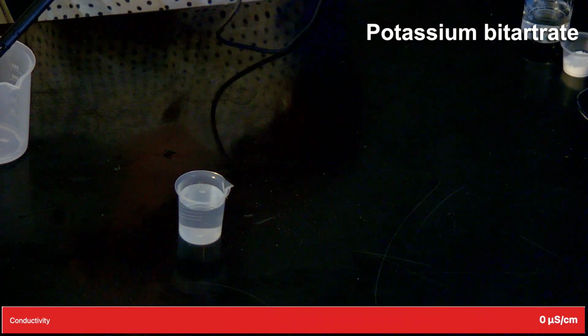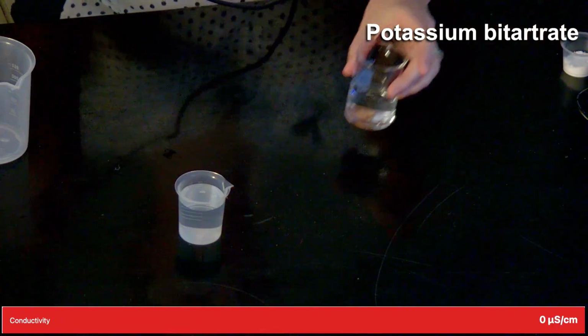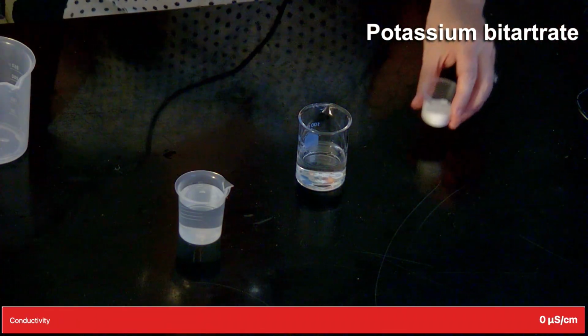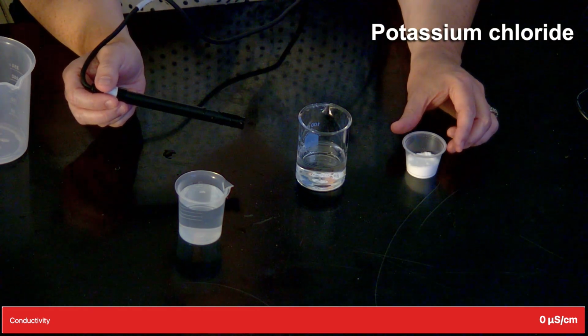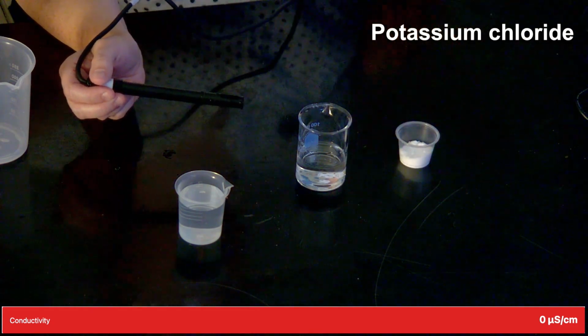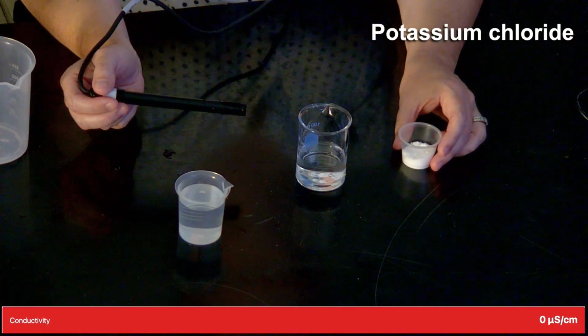I'm going to focus a lot, so that way it doesn't keep adjusting as well. Brilliant. All right.